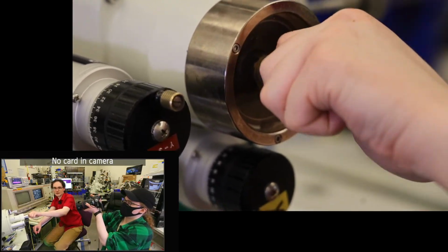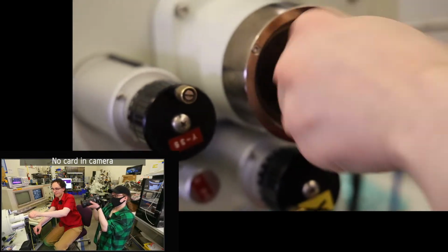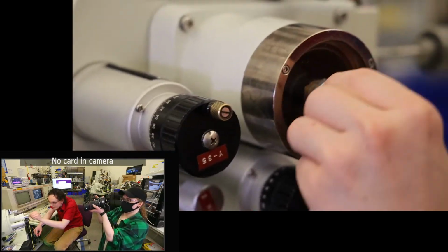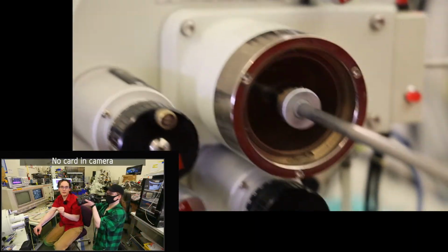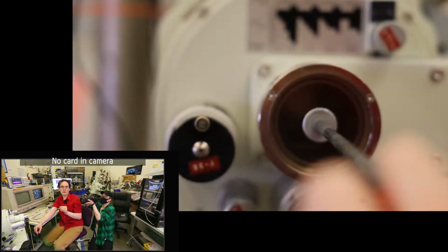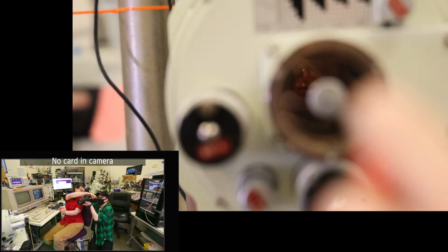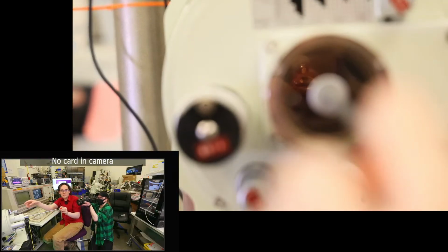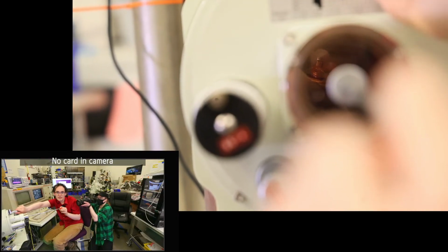Okay, that feels locked in, so we'll go ahead and unthread our sample rod now. So I'm real confident it's unthreaded, and I'm gonna watch it as I pull it out to make sure I'm not accidentally dragging the sample out. So if you want to try and get a shot down there, let's go ahead and bump that up. Yeah, so you can see our sample there, and I'll go ahead and tilt the stage so you can kind of see what part's tilting. That's our sample all the way in there.